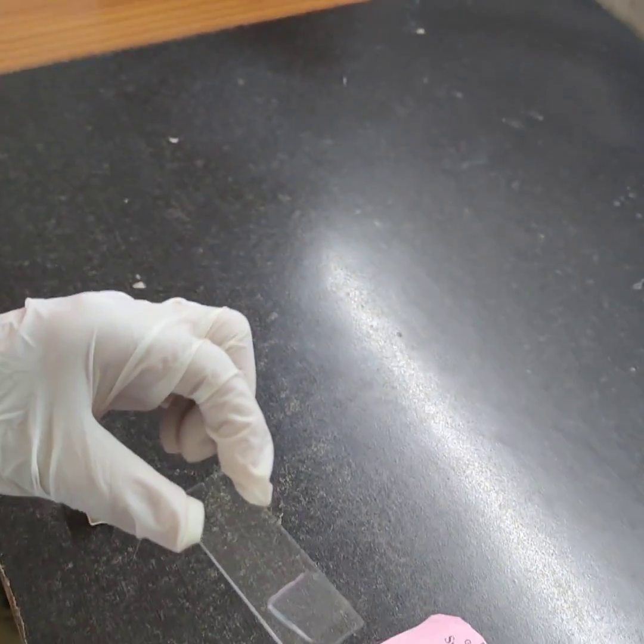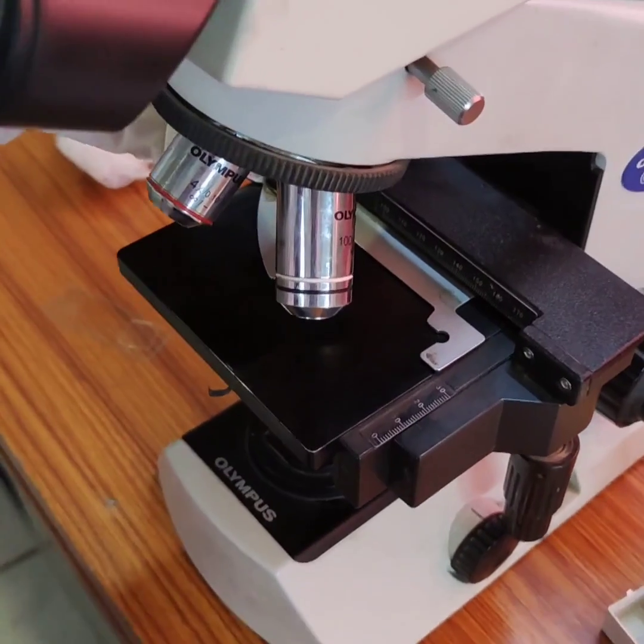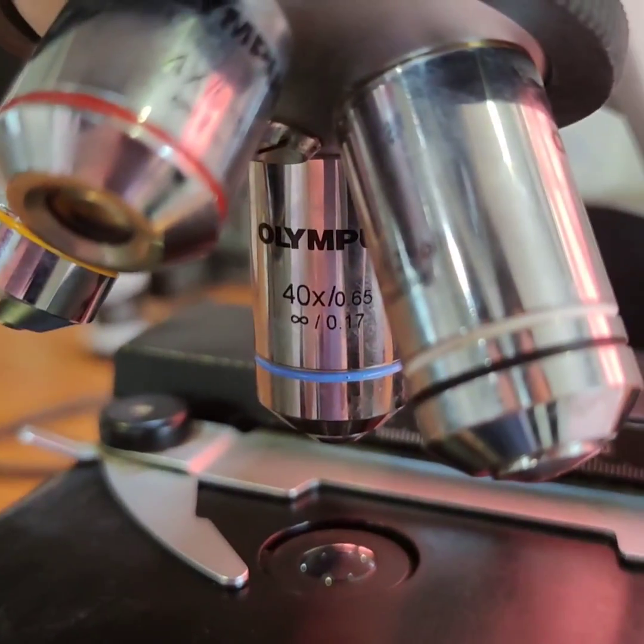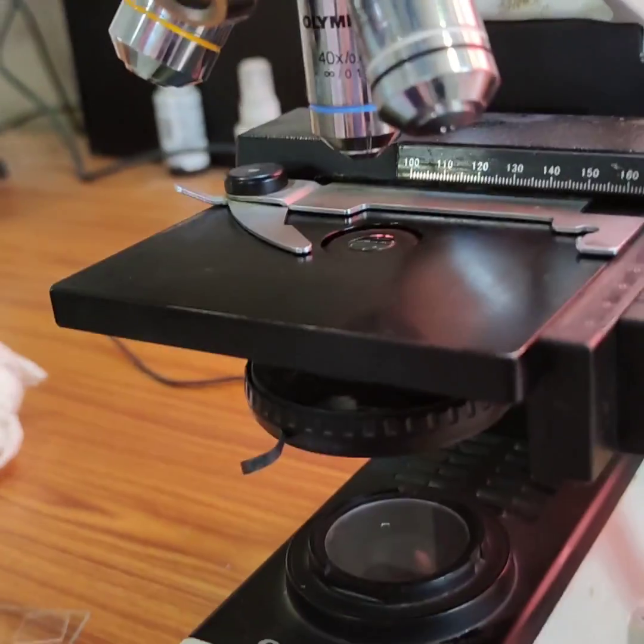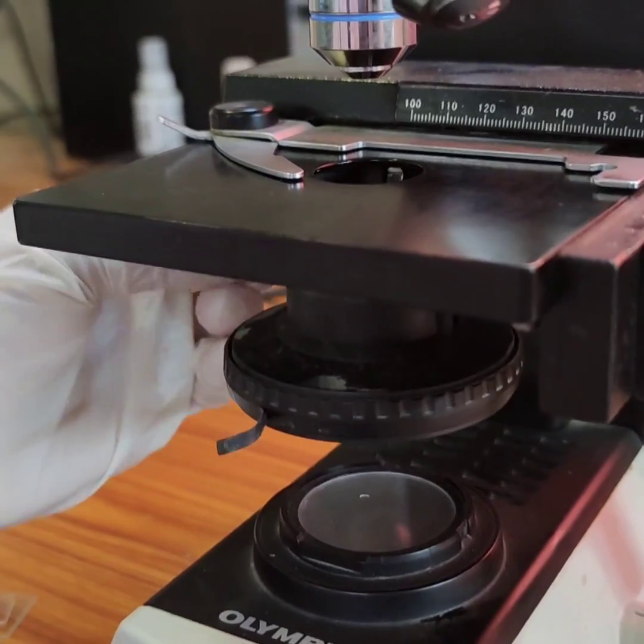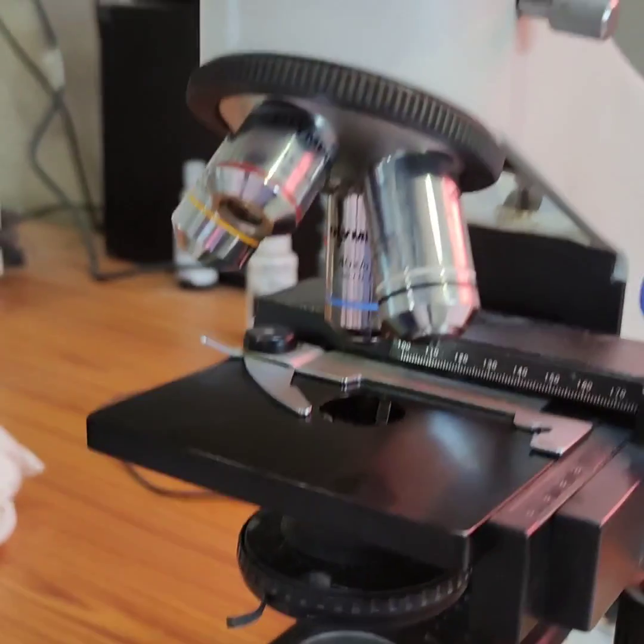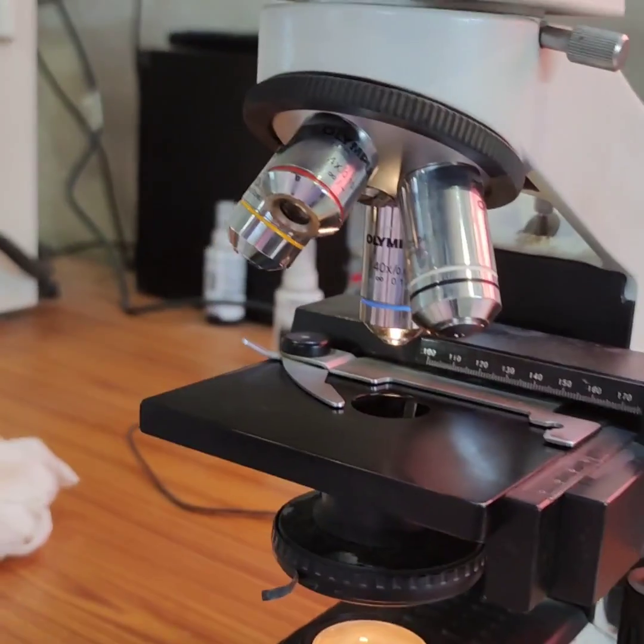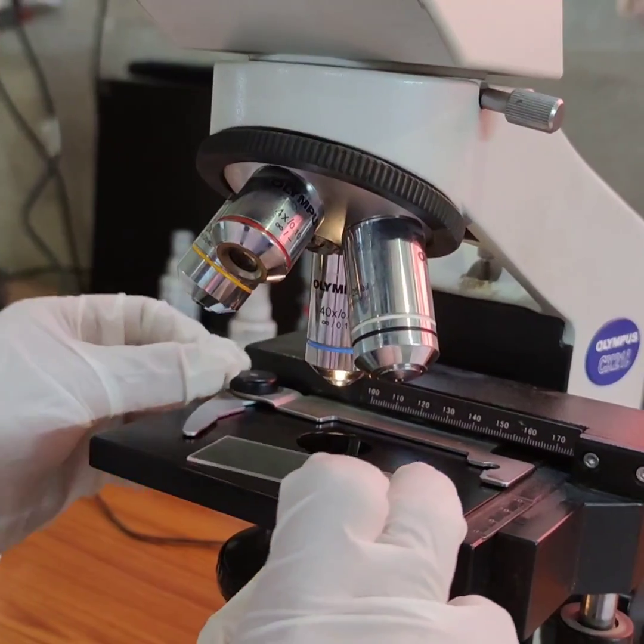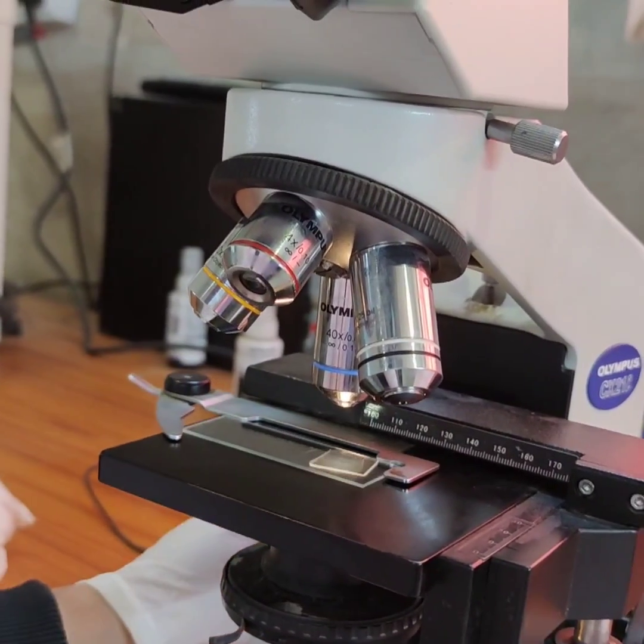It's okay. Now put the slide over the stage and fix it under 40x. Put down the condenser properly. Switch on the microscope. Fix the slide over the stage.